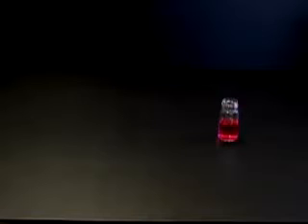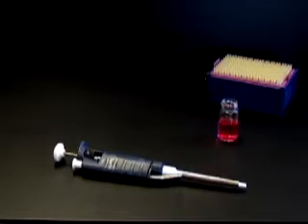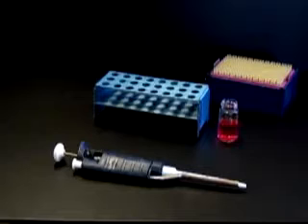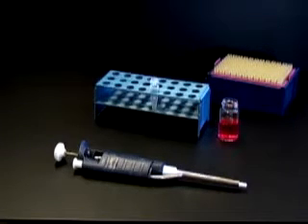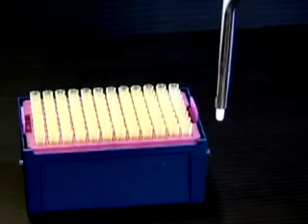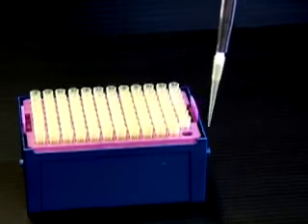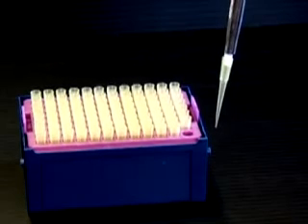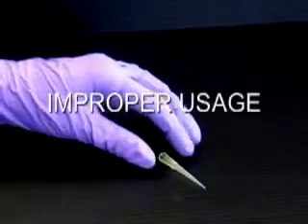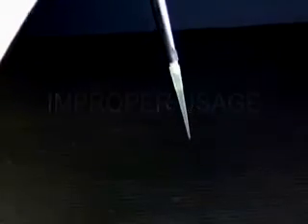Now it's time to transfer your sample. You will need your appropriately sized PipetteMan set to the desired volume, the correctly sized tips, a rack, the new container, a Kimwipe, and a waste container. Attach a disposable tip to the PipetteMan by pressing its plastic shaft firmly into the tip with a twisting motion. This action should ensure an airtight seal and prevent leaks from occurring. Always use a new sterile tip for each sample and never let the tip touch anything except sample.